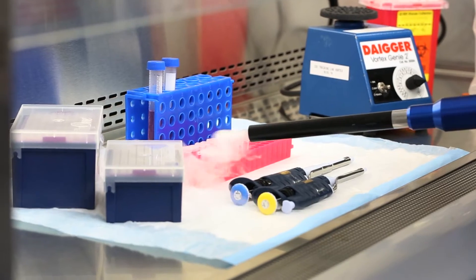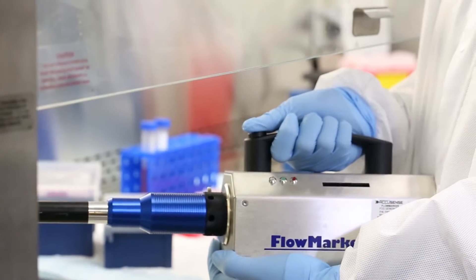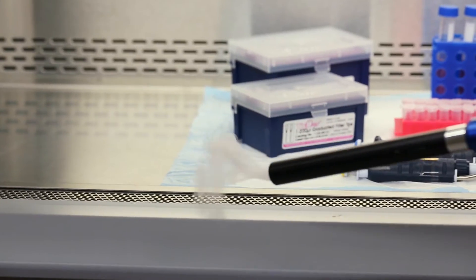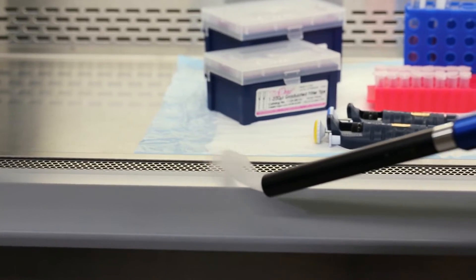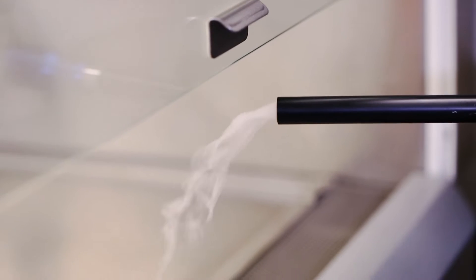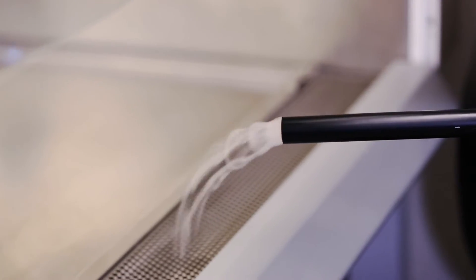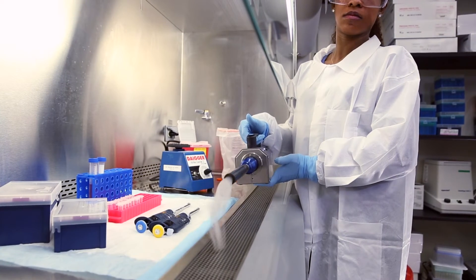But first, let's look at what proper airflow looks like. For proper containment, air is drawn into the cabinet at the opening and then down into the front grill. Together, the sash and inward flowing air provide an air curtain or barrier that is intended to keep cabinet air and room air separate from one another.